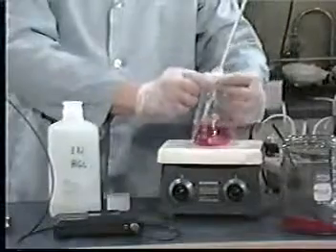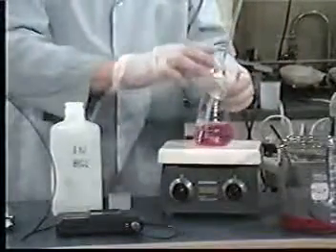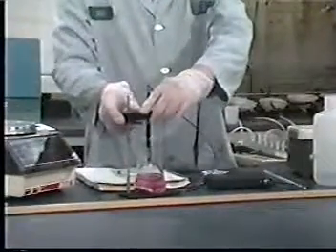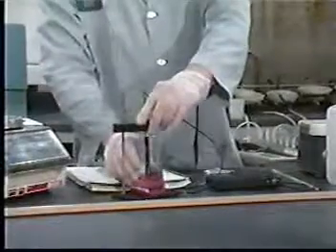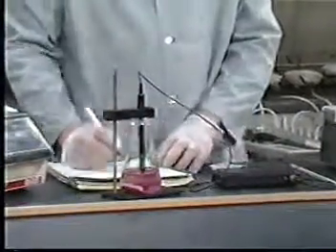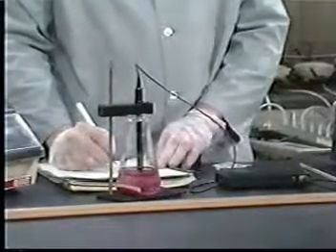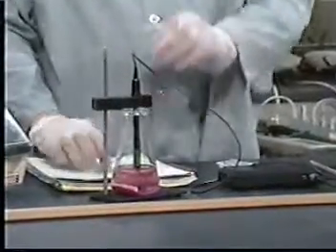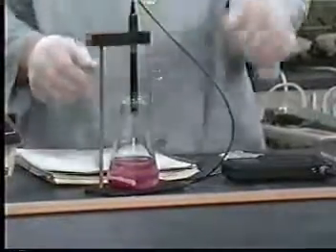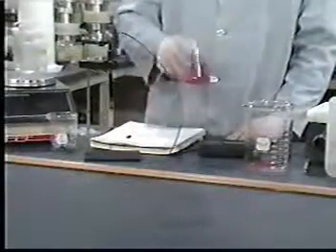Heat the slurry to 50 degrees Celsius and maintain for 10 minutes. After the solution has cooled to room temperature, measure and record the pH again. If it is now less than 5, use fluid number 1. If the pH is still greater than 5, then the waste has a strong buffering capability and fluid number 2 should be used. The preliminary determinations are now complete.